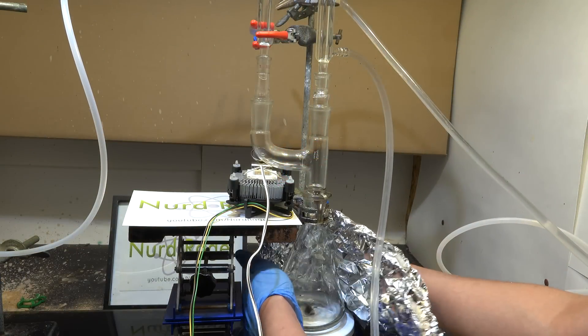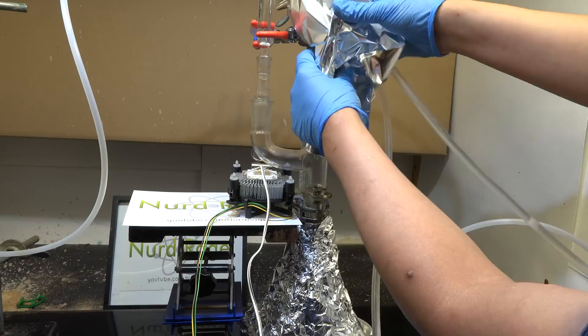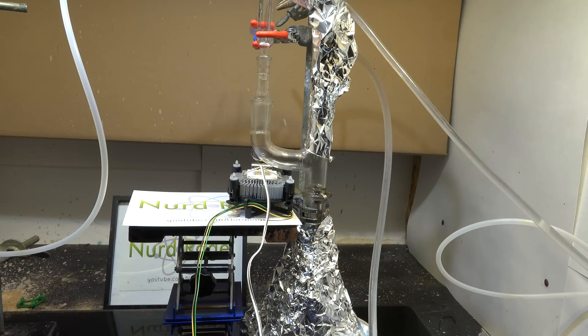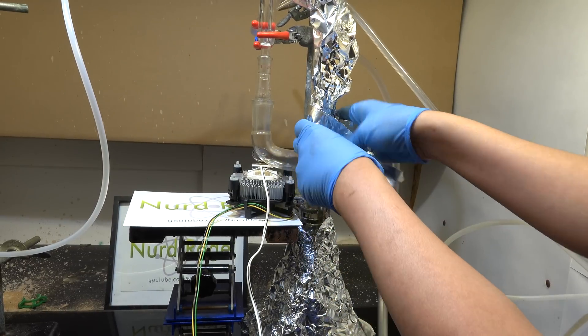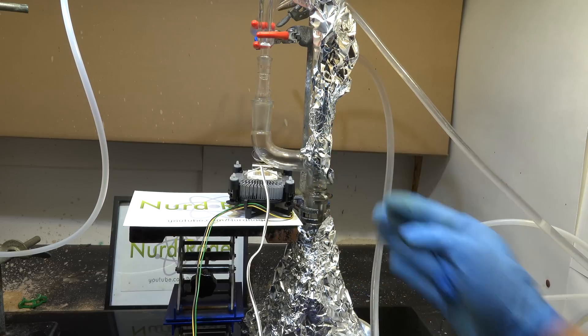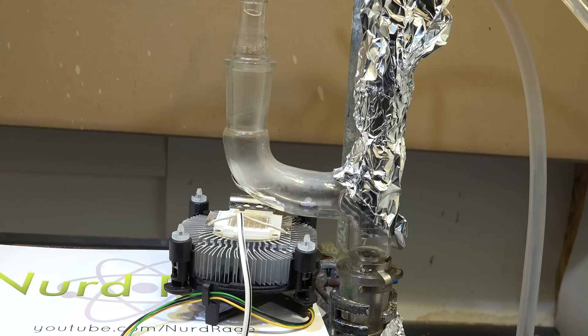So let's begin. I'm going to put some aluminum foil around the flask to insulate it so it boils easier. I'm also going to put some foil on the inlet column to protect it from the UV light. To be honest this was a useless move so don't bother when you do your reaction. Turn on the heating, the cooling water and wait until the p-chlorotoluene starts to reflux.